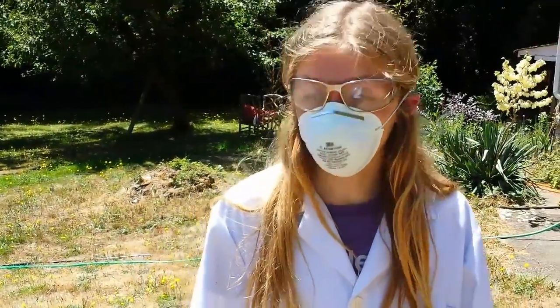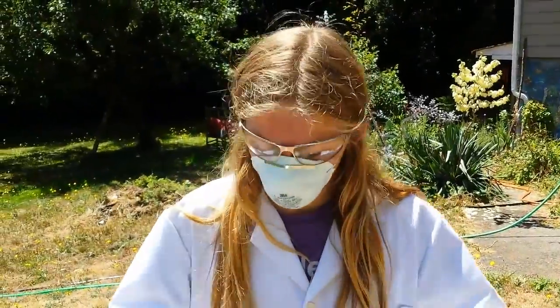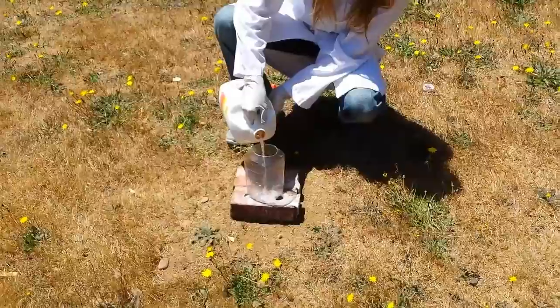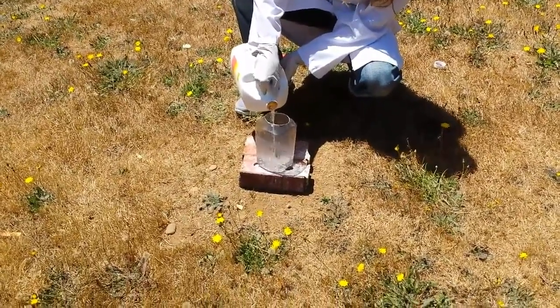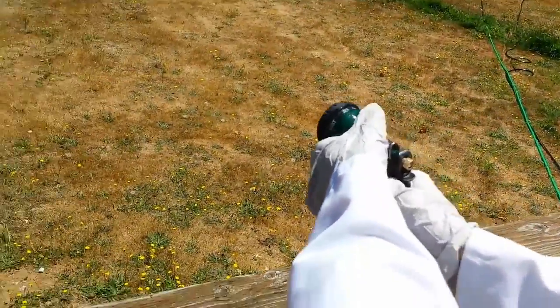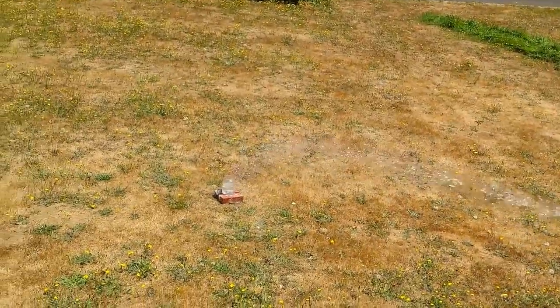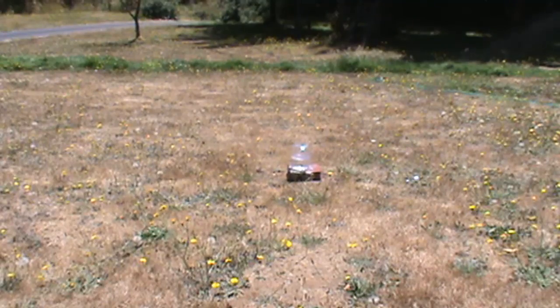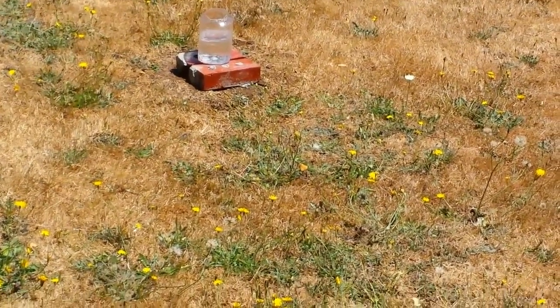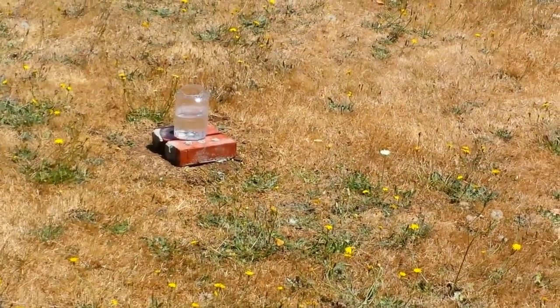Okay, what we're gonna do now is test what happens if you pour water into acid. Here we go. Supposedly the acid should boil and explode, but who knows — the books might be overly cautious. Plus, this is muriatic acid, a relatively weak acid. It doesn't look like it's doing anything. I guess the books are overly cautious. You can rest easy knowing that acid will not always explode in your face if you choose to wash an acid container improperly, although we did use a weak form of acid — muriatic acid.